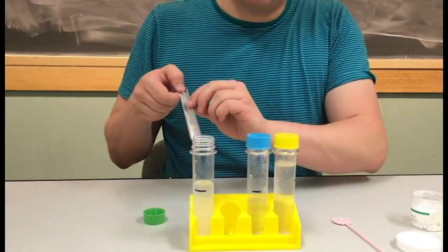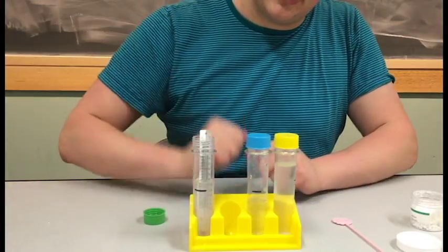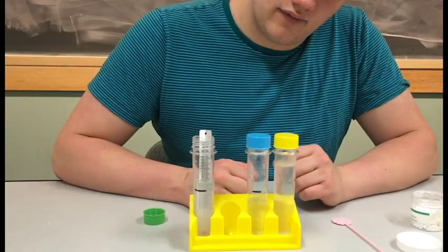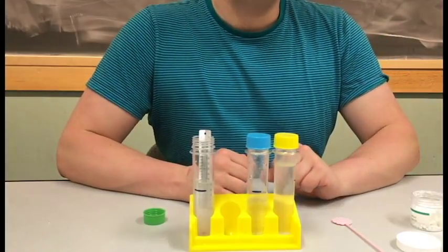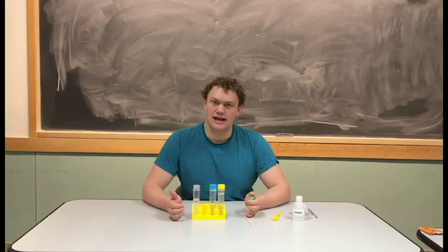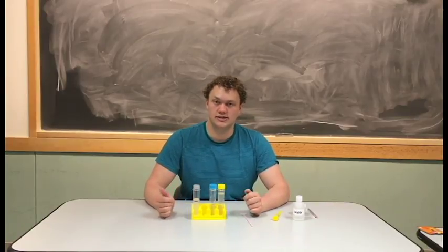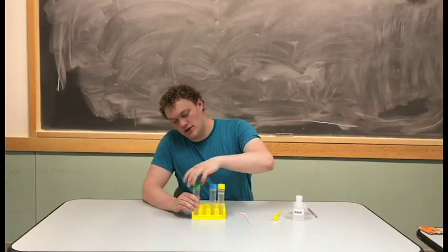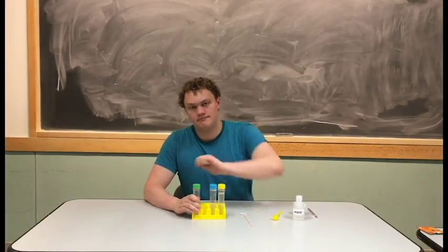And then they're going to record the highest temperature the water reaches, which should be about an increase of 15 to 20 degrees. If there's a sink in the classroom, you can dump out the test tubes in the sink. If there isn't, put the lid on tightly and take the liquids back to the VSVS lab.